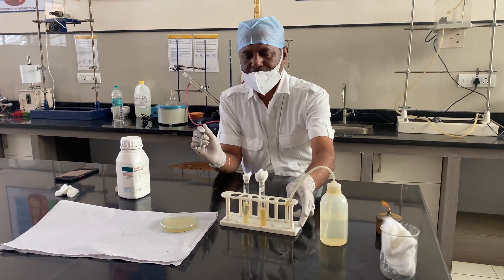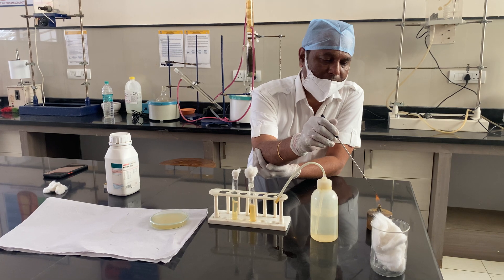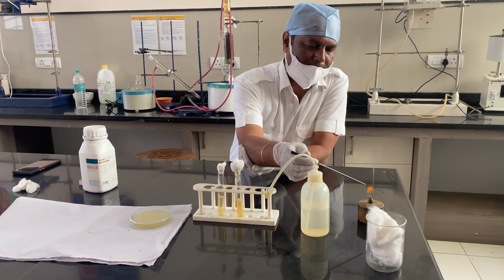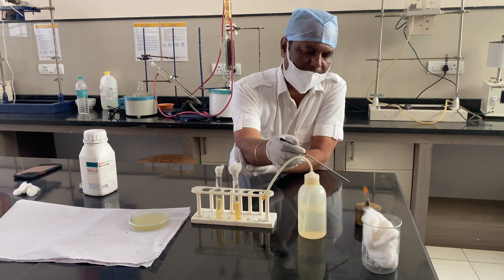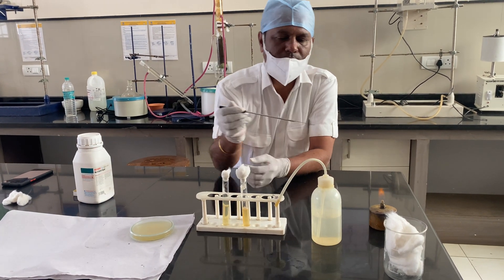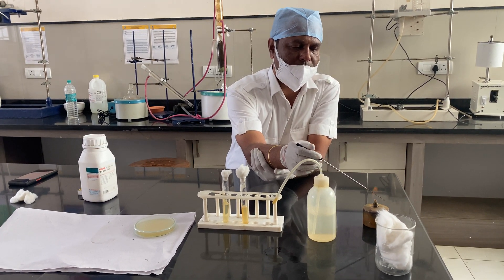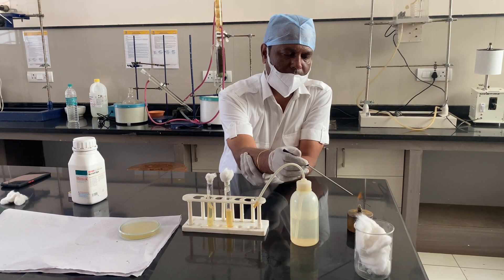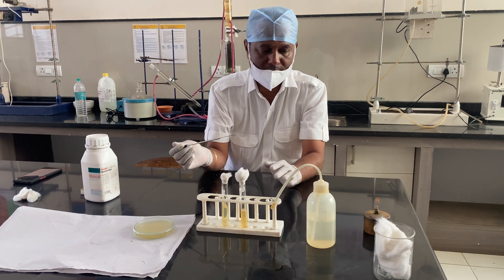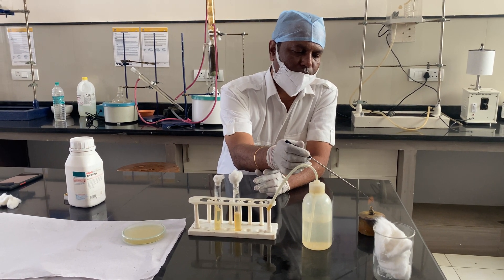Now, keep in mind that this is the inoculation loop, and we are going to sterilize it. This is the only method by which we can sterilize the loop. Once it is sterilized, you are not supposed to place it down anywhere. After sterilization, wait for about 10 to 20 seconds before using it.